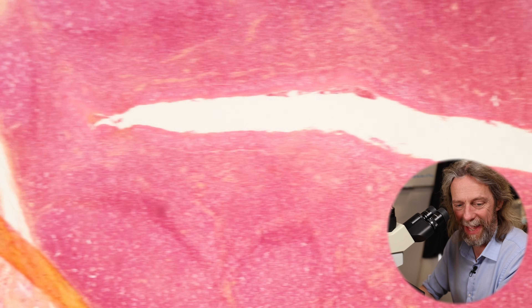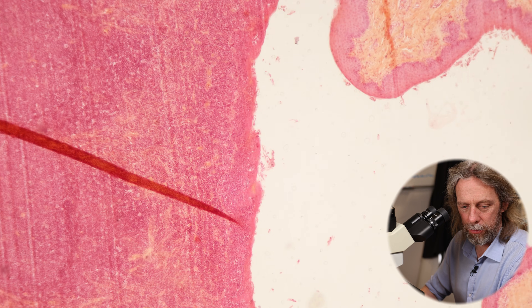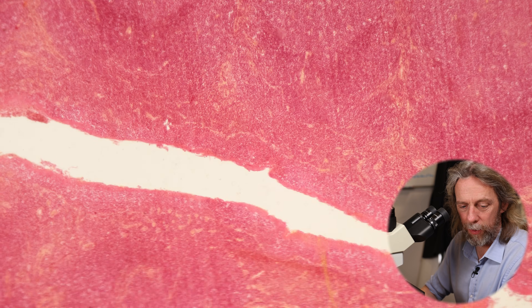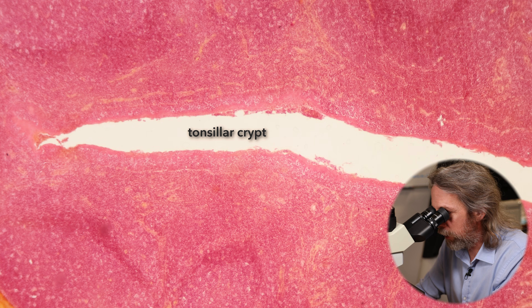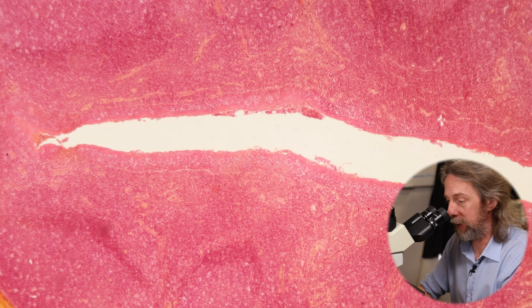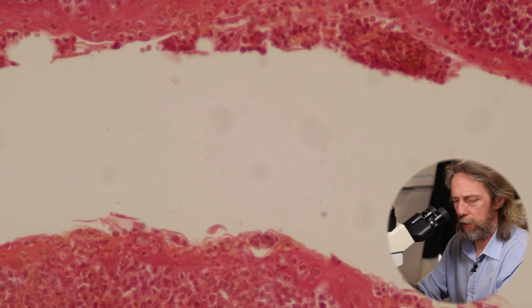Underneath the epithelium we can see a tonsillar crypt. The surface of the pharynx is out here, and these crypts go all the way around and into the tonsil — there can be 15 to 20 crypts extending into the tonsil. What they do is increase the surface area and increase the chances of lymphocytes in those lymphoid follicles encountering invading pathogens. In there we would see cellular debris, pathogens, lymphocytes, and all sorts of material.